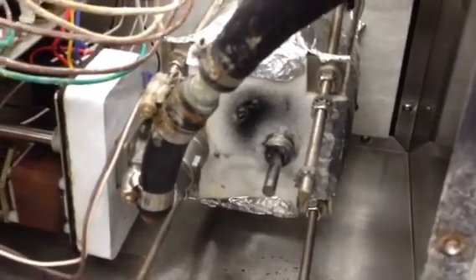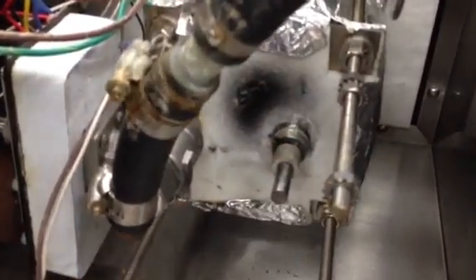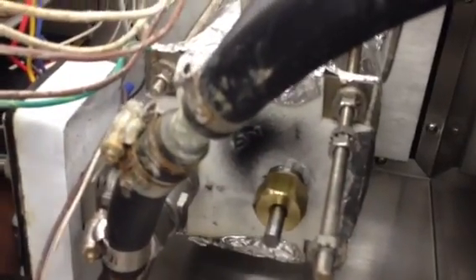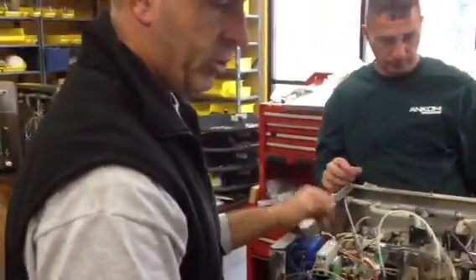Now you want to take the new PEEK bushing, slide that up, and we're going to use the packing nut to compress everything together. Basically, start the packing nut on. Tighten it by hand until you can't tighten anymore, and then we have to take the packing and compress it all the way up inside. So it does take some force to screw the packing and get everything compressed. So we'll take the pressure wrench now.